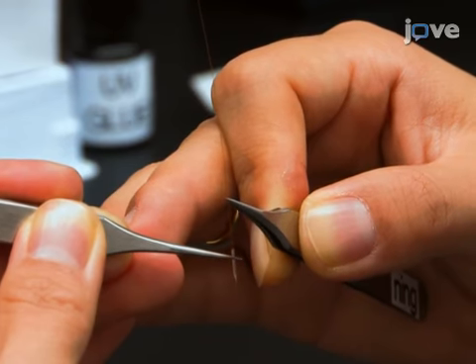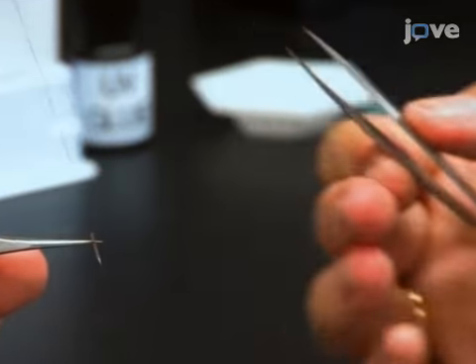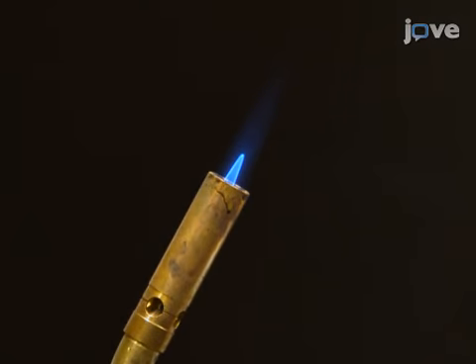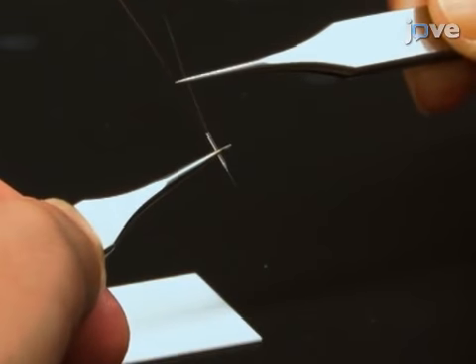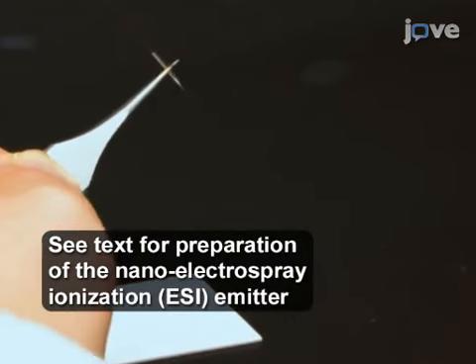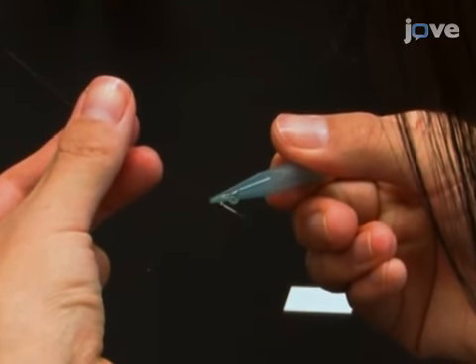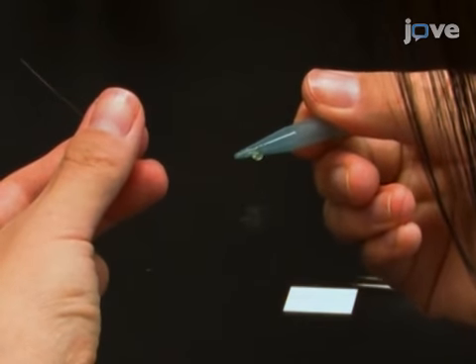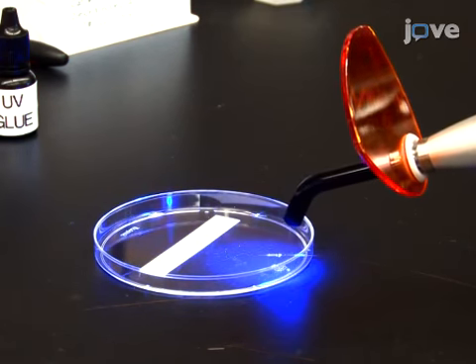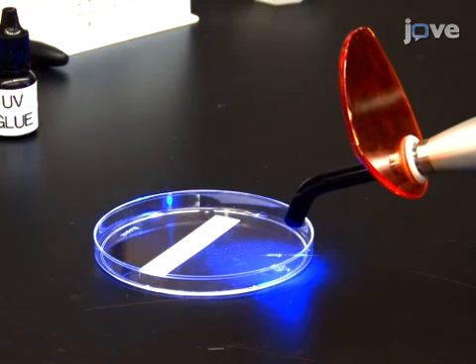Then, insert the capillary into one bore at the flat end of the dual-bore quartz needle. Using the flame to pull a fused silica capillary as a nano-ESI emitter, cut to 7 to 10 millimeters long and insert it into the other bore at the flat end of the dual-bore quartz needle. Apply a minimal amount of UV curing resin onto the flat end of the dual-bore quartz needle. Solidify the resin using an LED UV lamp for approximately 20 seconds to secure the solvent-providing capillary and the nano-ESI emitter.